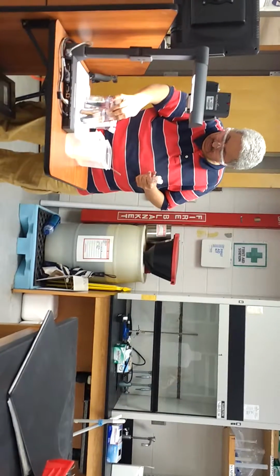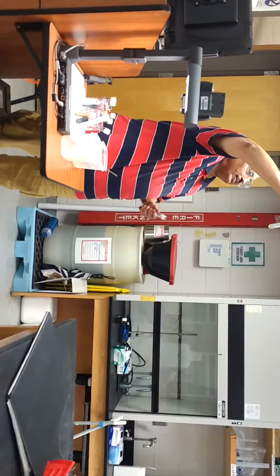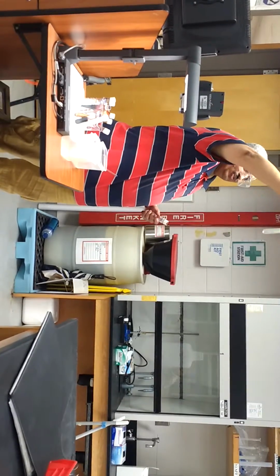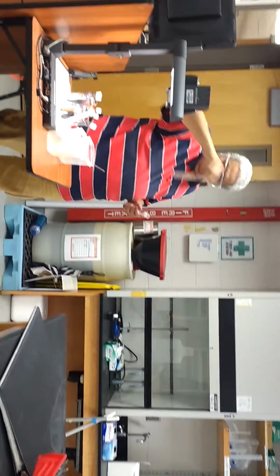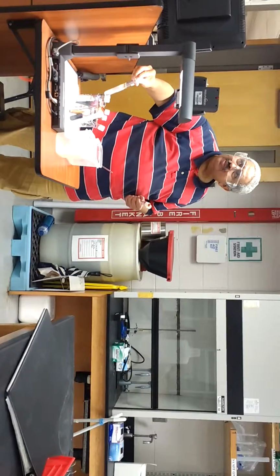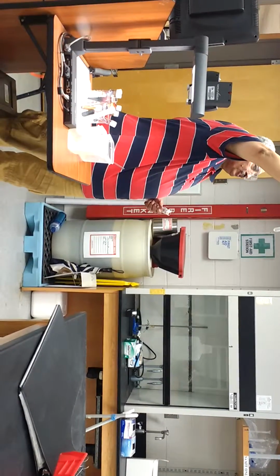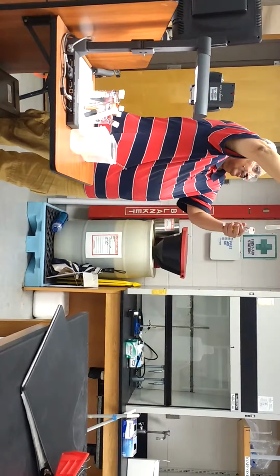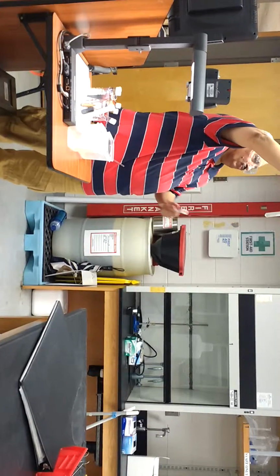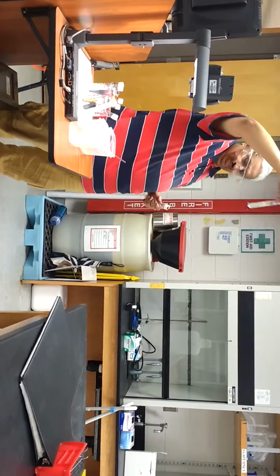And the last one here, cyclohexane. And then when it comes to oil with H2O, oil is non-polar. Can you see two layers? Let me show you here, maybe in the picture. Can you see two layers? One is yellowish on the top, light, meaning H2O is more dense, it sinks to the bottom layer, and the lighter one, less dense, will be floating on the top. So oil is not polar and it's not soluble in H2O.